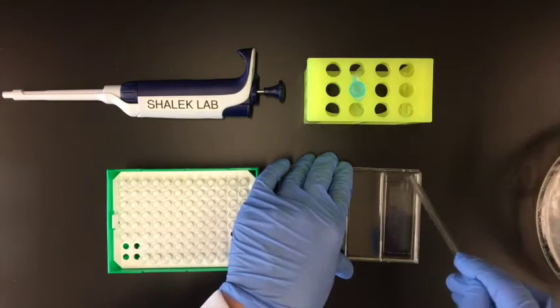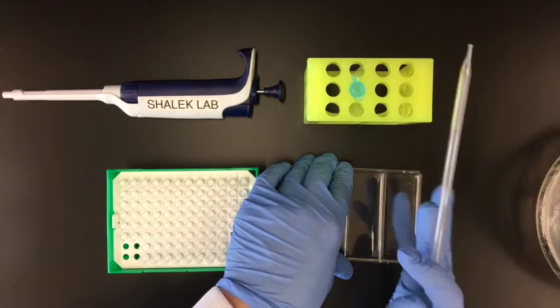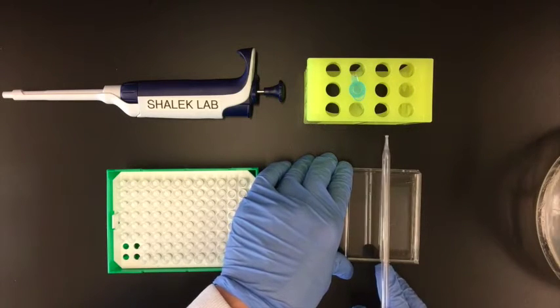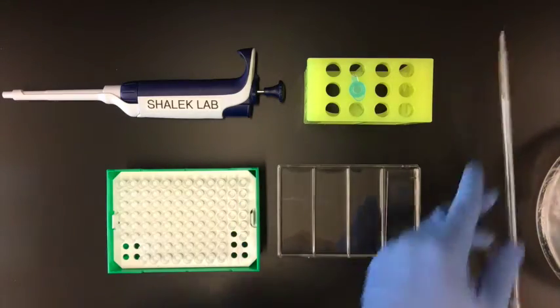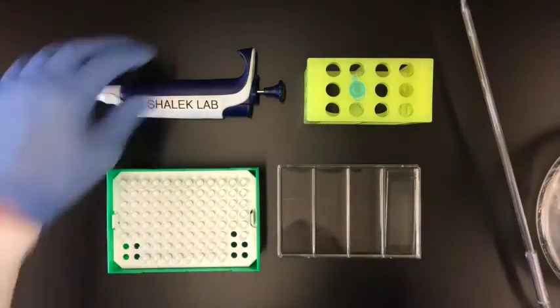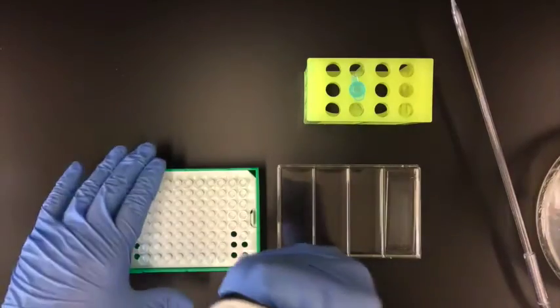Let me demonstrate that one more time. So rather than having it parallel with the edge of the dish, I want it slightly off center. So I'm going to move it over and now the beads won't fall out or be pulled down into the dish.